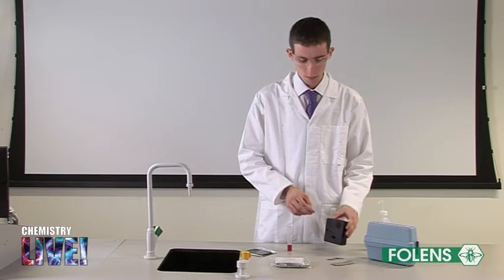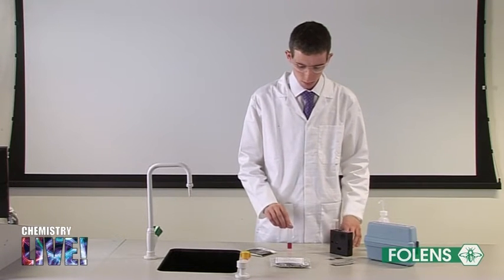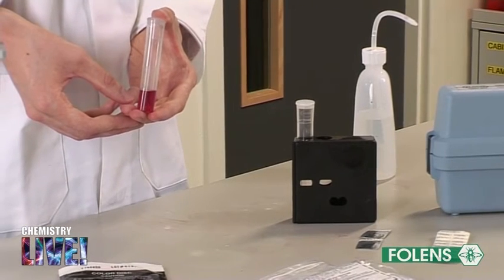5 cm³ of the swimming pool water has been added to the other viewing tube and a DPD tablet was also added. A pink coloured solution is obtained.